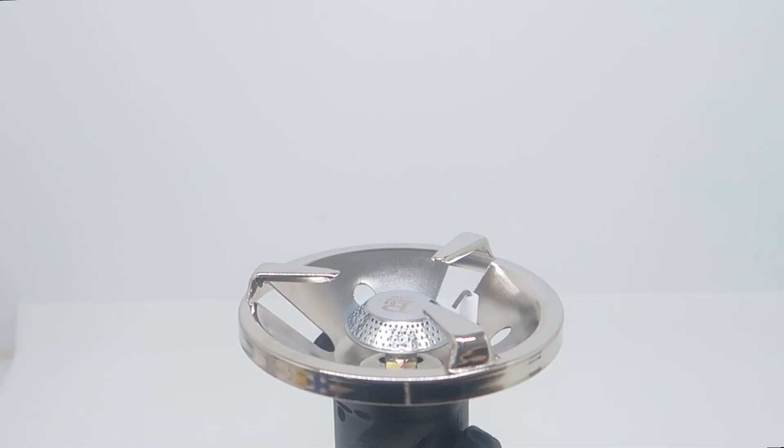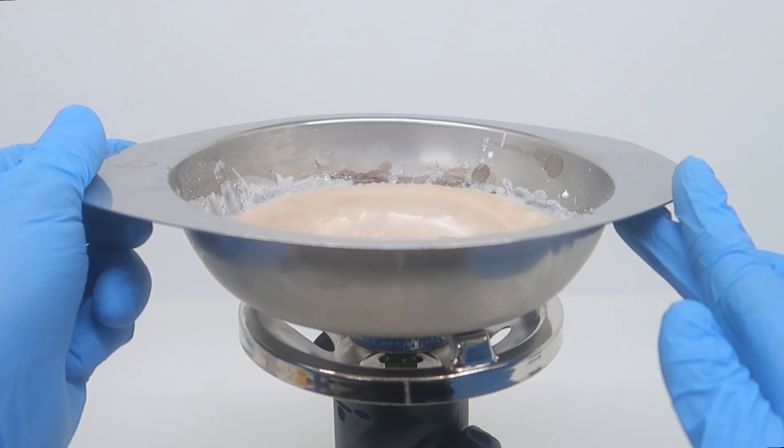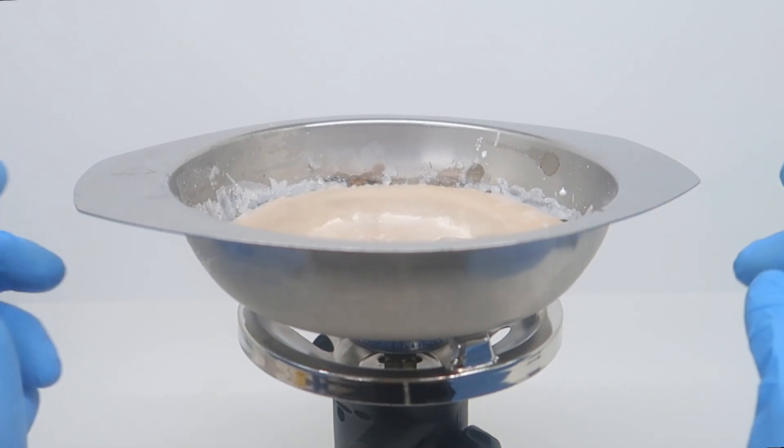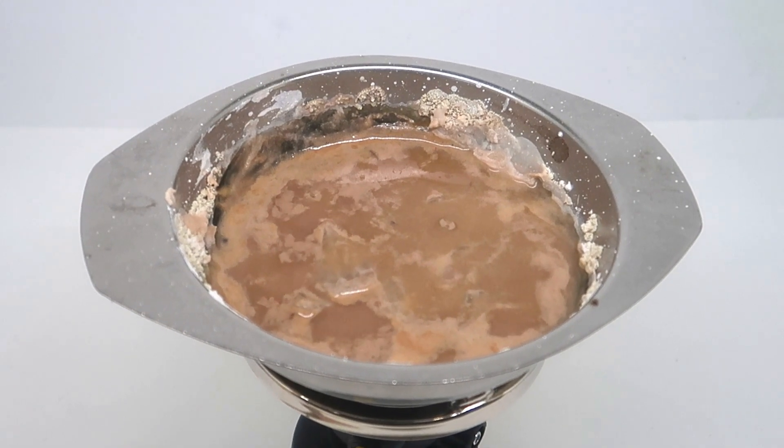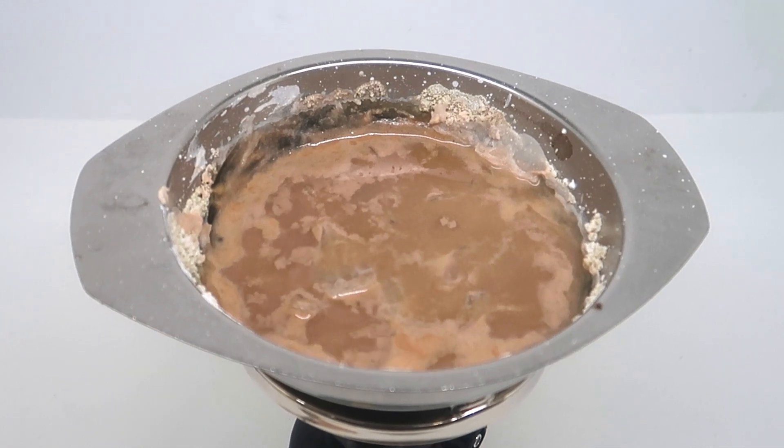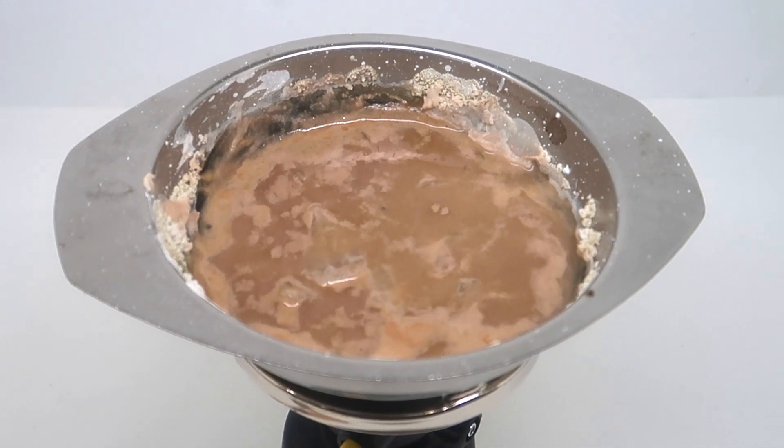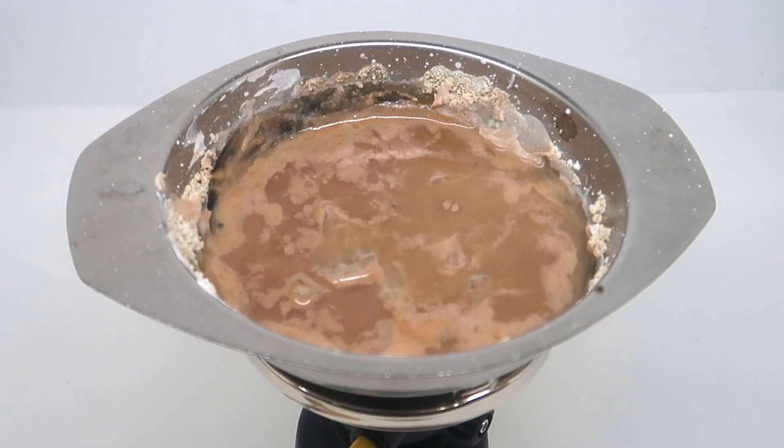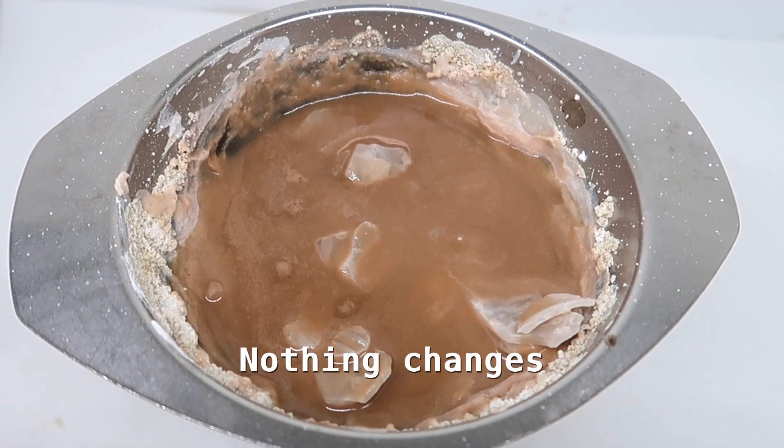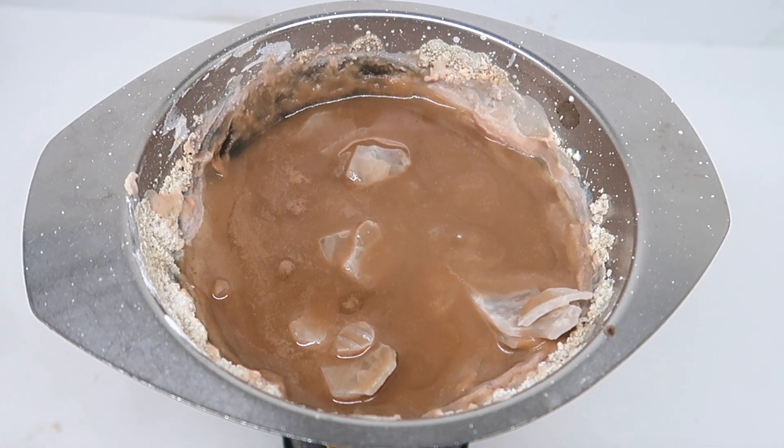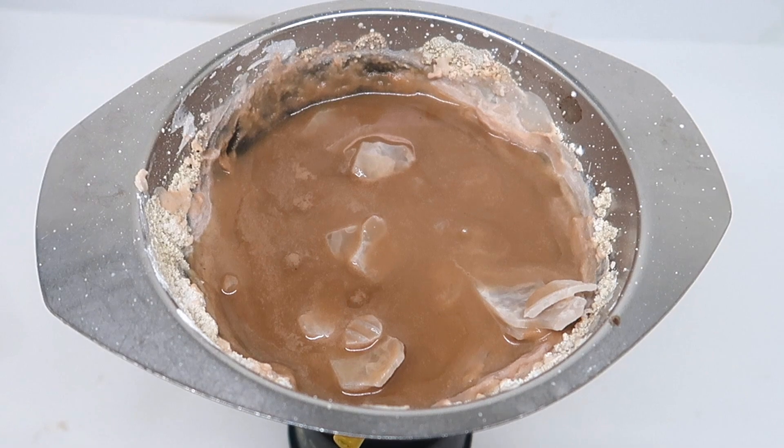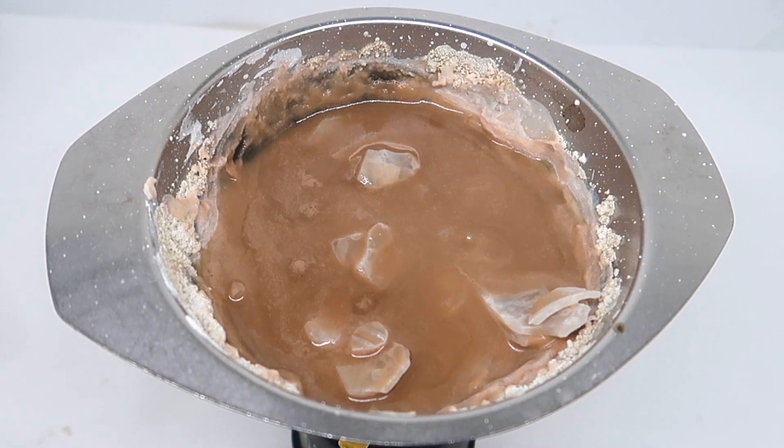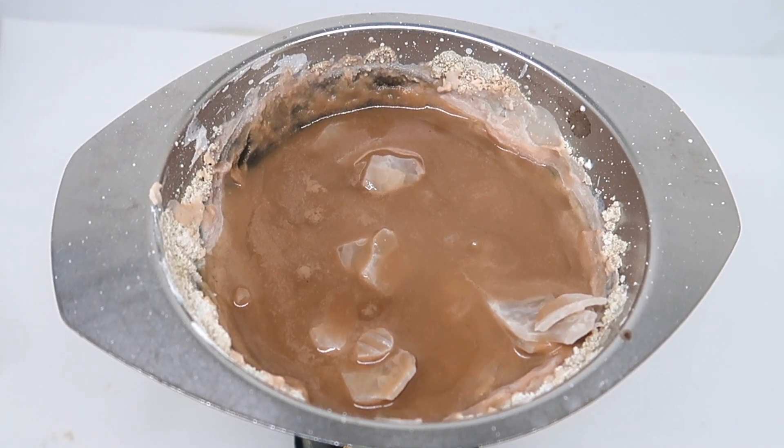Anyways, the next day, I bought myself a camping stove and started heating the thing again. However, after two hours of continuous heating, I came to the conclusion that it was just never gonna work. In fact, the pieces I used were much too big and I should have used powdered glass or sand instead. I thus decided to quit, and once everything cooled down, I dumped everything off-camera in a huge bucket of water to dissolve it all. But then, something unexpected happened.